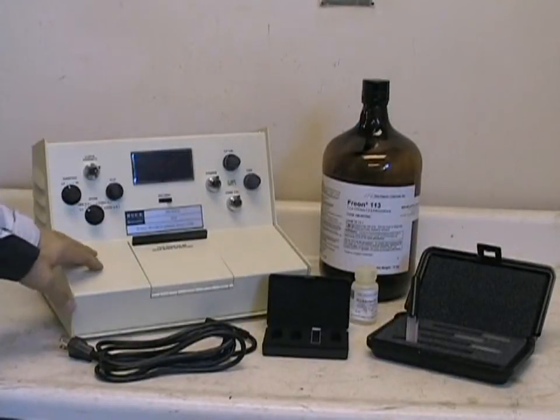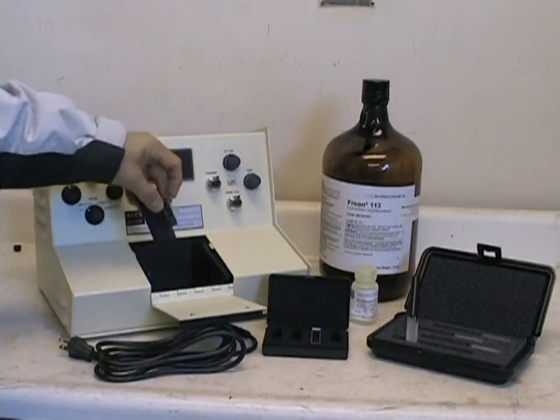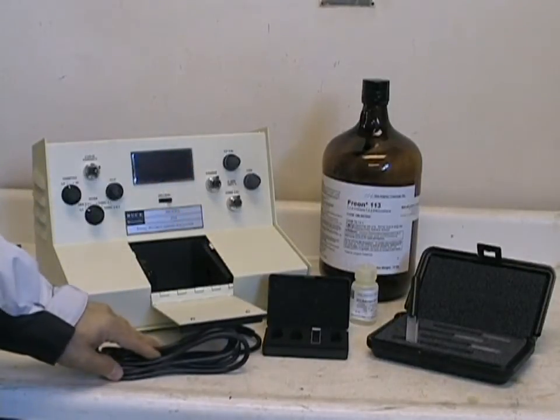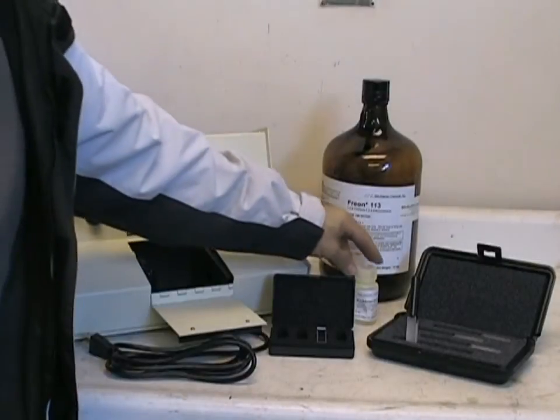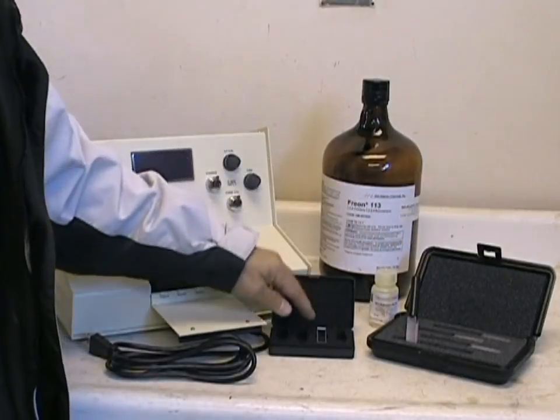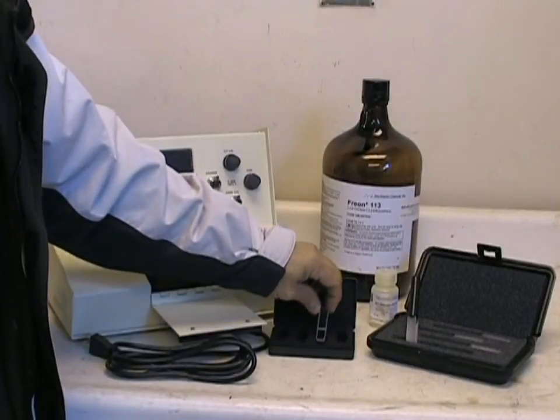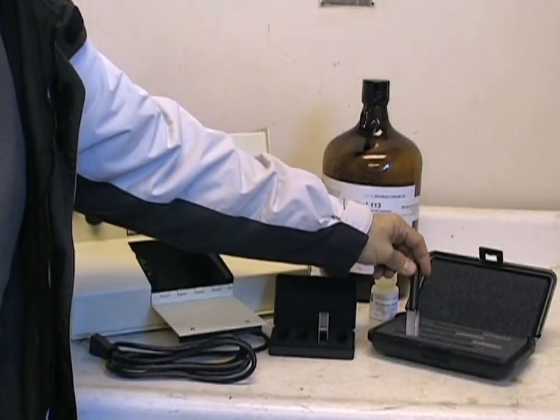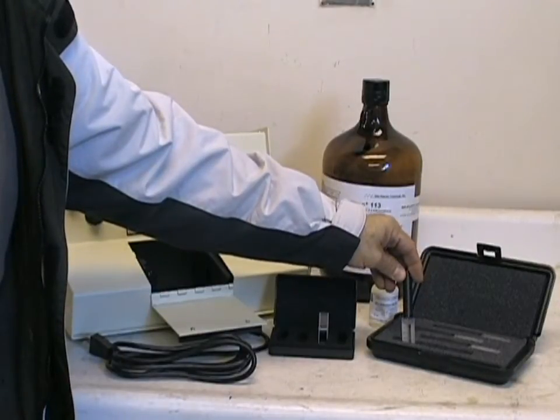The basic Model HC-404 Hydrocarbon Analyzer includes a standard 10 millimeter or one centimeter cuvette holder and a 110 or 220 volt power cord. Optional supplies include the 404-11 EPA reference oil, the 1i10 infrared quartz cuvette specifically suited for hydrocarbon analysis, and the 404-12 sealed freon calibration standards, which are also available in carbon tetrachloride.